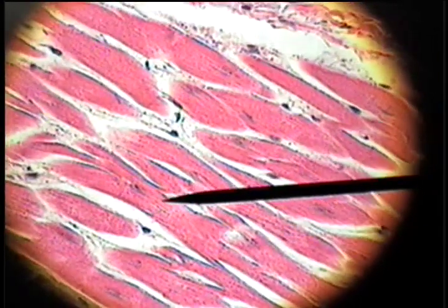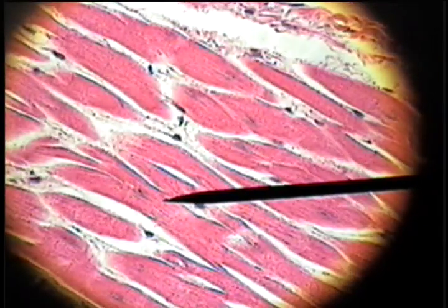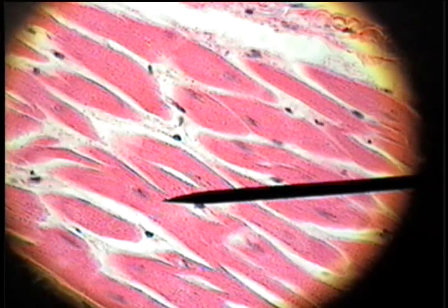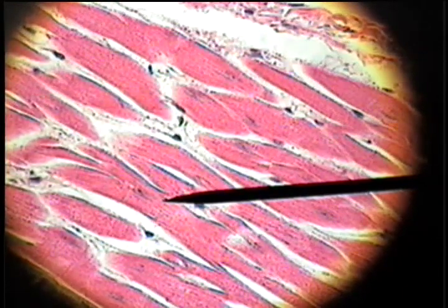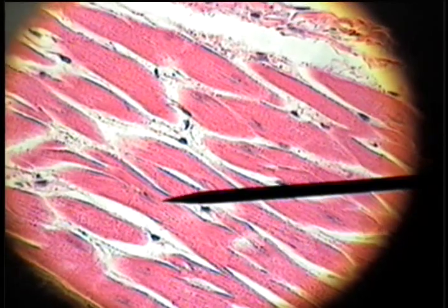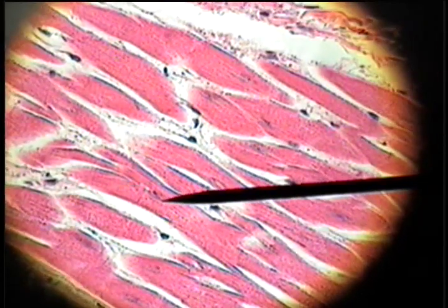Cardiac muscle is cross-striated, though it's not as prominent in this slide as in skeletal muscle. Also, the nucleus is located in the center of the cell.